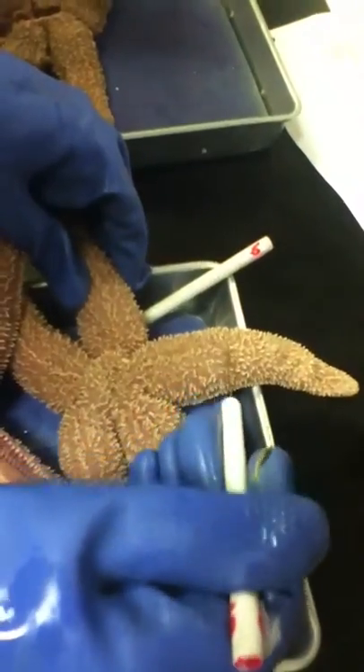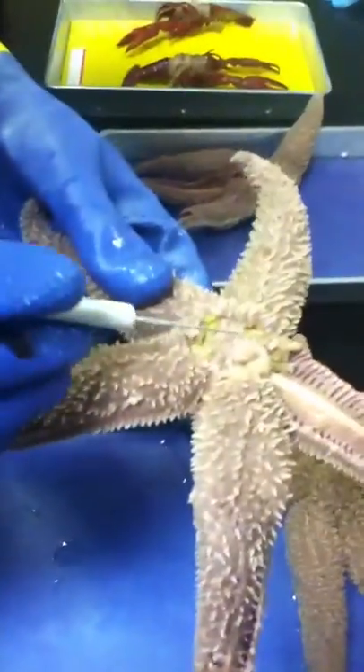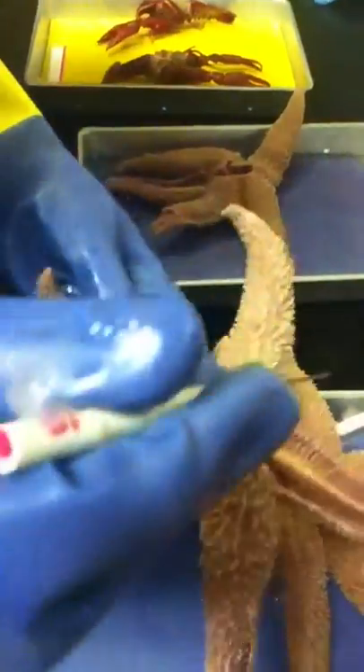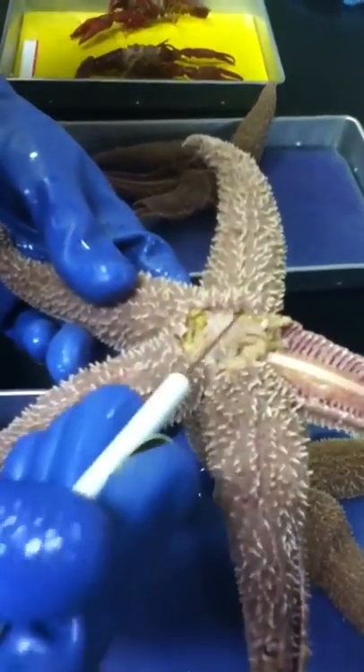What's all the soft stuff? Skin gills. Inside, this in the middle — stomach. You don't have to know which ones. Actually, this is a nice pyloric one on top that's separate, but we usually can't see it that good.